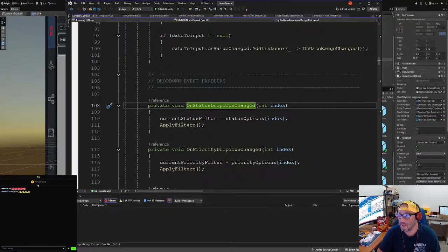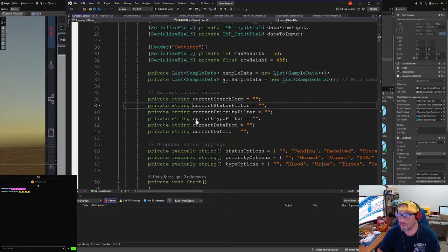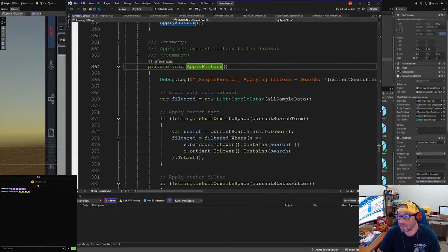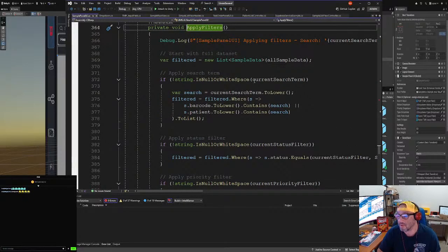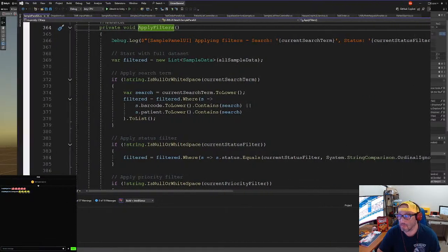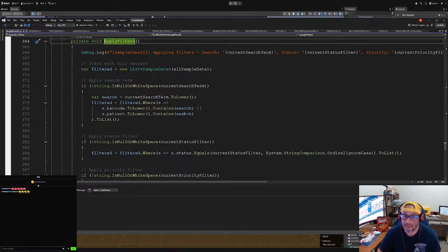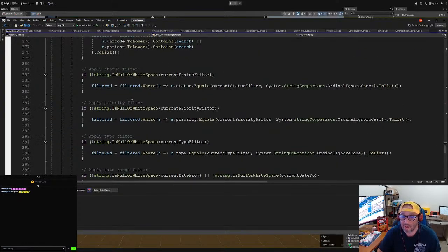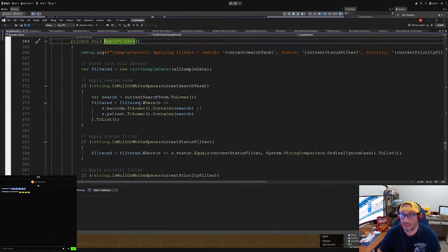Once that's done, this is the current filter, which is the filter that's here, the string, and then you apply the filters. When you apply the filters, this is how we run it. Let me make this a little bigger so you guys can see the whole thing. Sorry about that. So you see all sample data, and then where we filtered. We're filtering not at the Supabase, database level; we're filtering after we get the data.